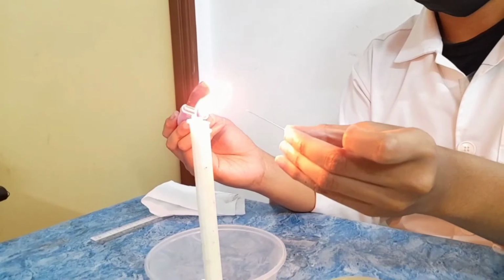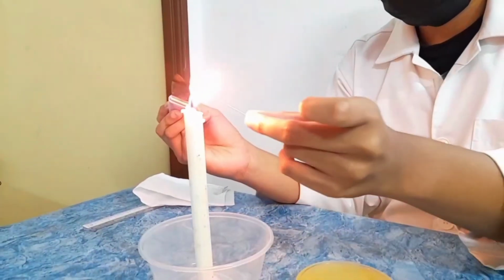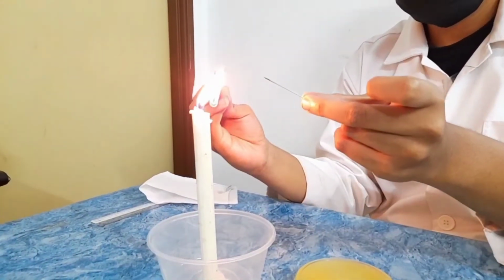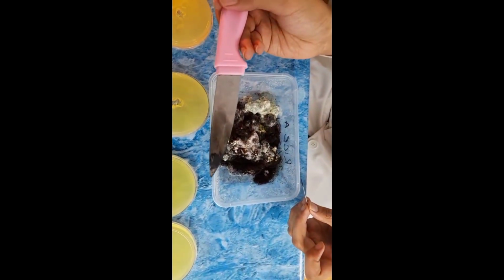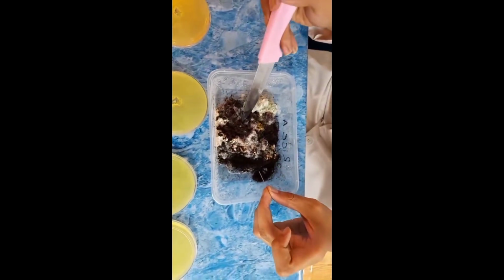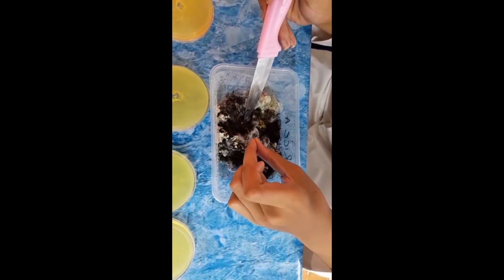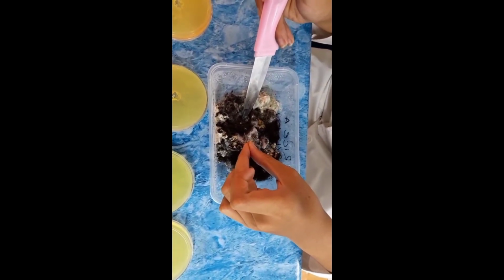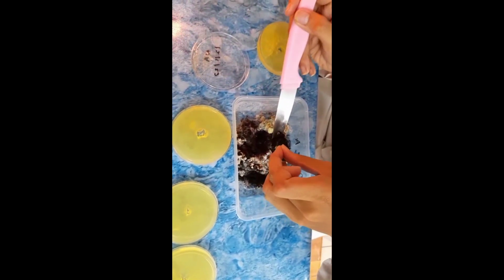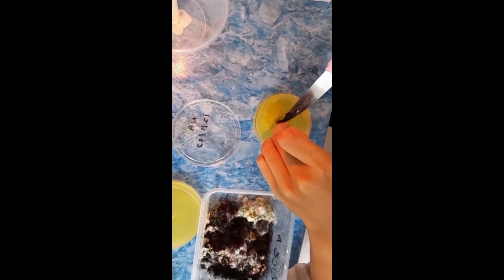Now, we take one container of experimental food sample from part 1 and we sterilize the blade of the sharp pointed knife and also a needle by flaming on the flame of a candle. Next, we carefully open the food sample container and observe the area where fungal growth is visible. Using the sterile knife, cut a piece of the food sample with the fungal growth, and with the help of the other hand, use a sterile needle to hold the food sample in place while cutting it. After cutting it, we remove the small piece of food sample using a sterile needle and transfer it into the hole on the NA plate.